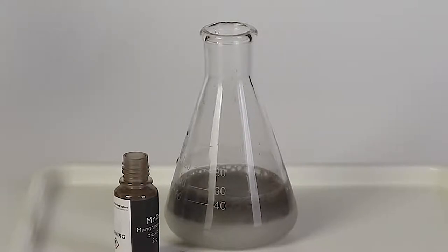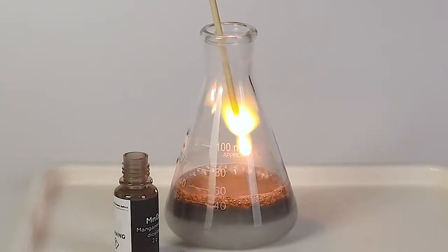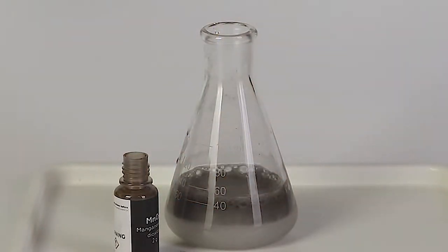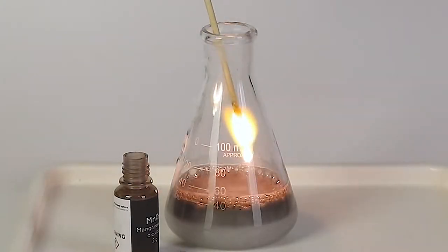Remember to place the flask on the tray. This is an exothermic reaction and the flask will get very hot during the experiment. Be careful not to touch it, but wait until it has cooled down.